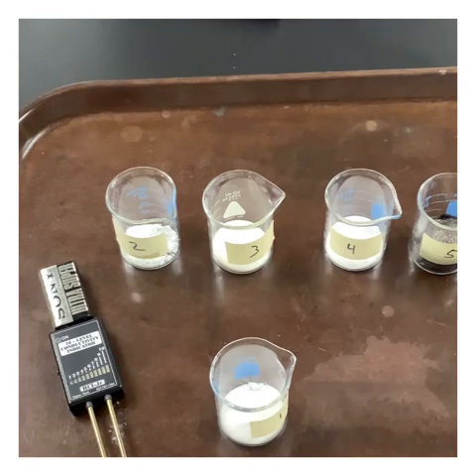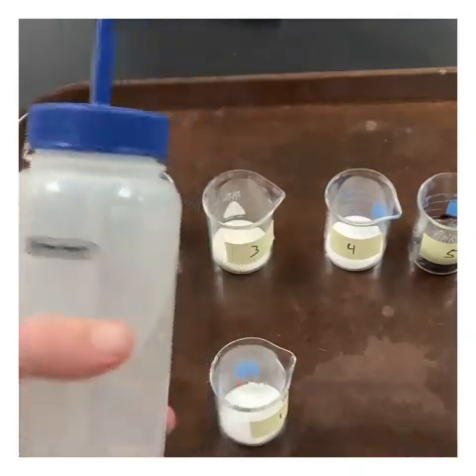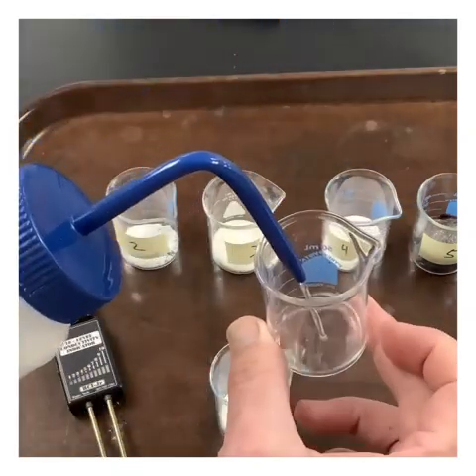Because distilled water is not supposed to conduct electricity, but occasionally because of impurities, or somebody in lab accidentally refilled the bottle from the sink so they have tap water in there, something like that, that could really mess your data up. So we want to test the water first. This should not conduct electricity. Let's double check that it does or doesn't.